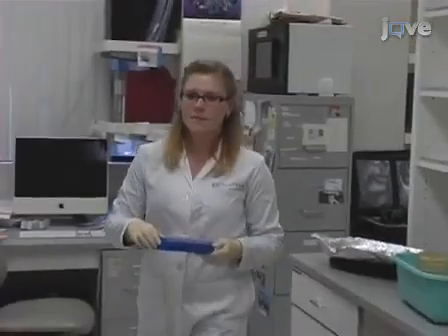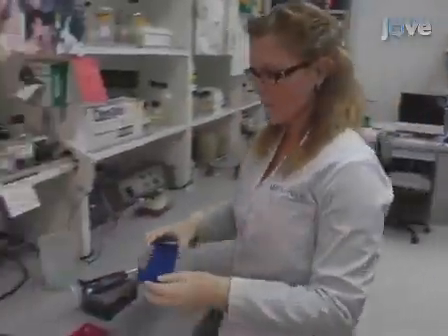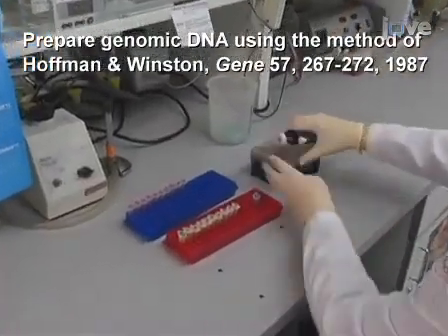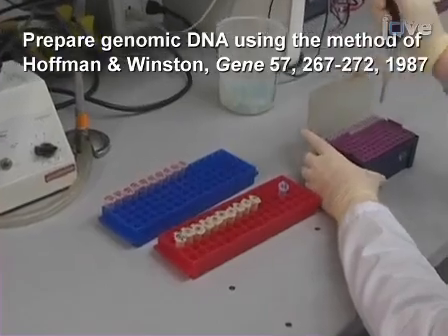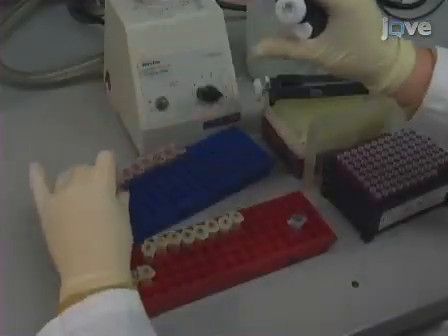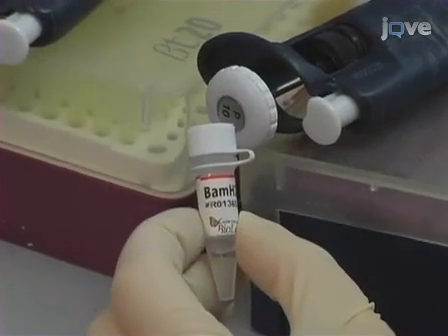Putative translocation-bearing clones can be examined by Southern blot. This procedure uses genomic DNA prepared from a single His plus recombinant colony from each independent trial. Digest approximately 4 micrograms of each DNA sample with BamHI restriction endonuclease.